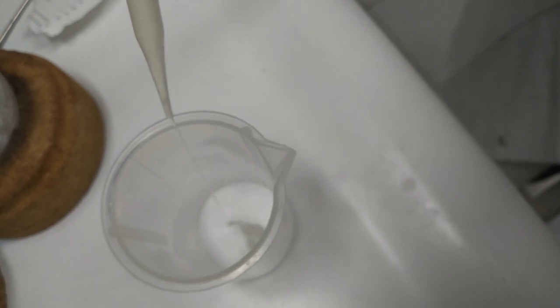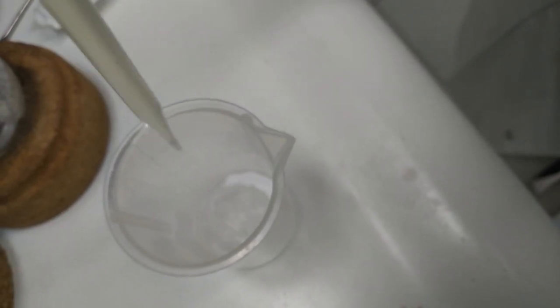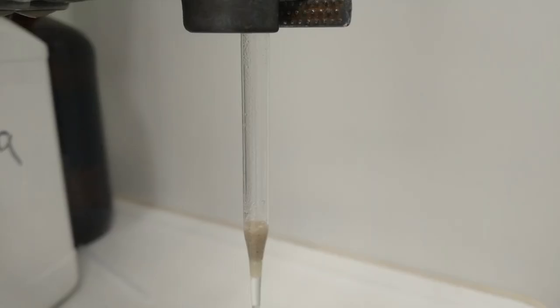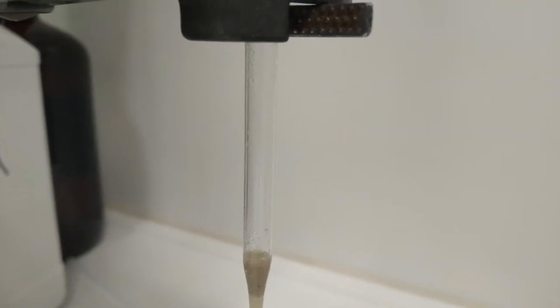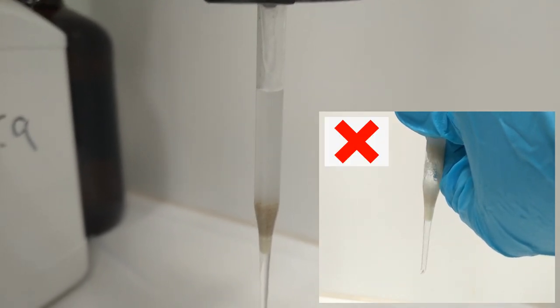Now it's time to make slurry for the column. Solvent is added to silica and poured onto the column as a slurry material, then pack with pressure. Make sure to avoid cracks while packing.